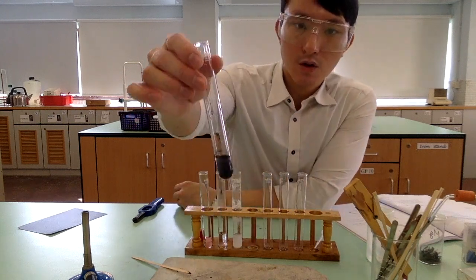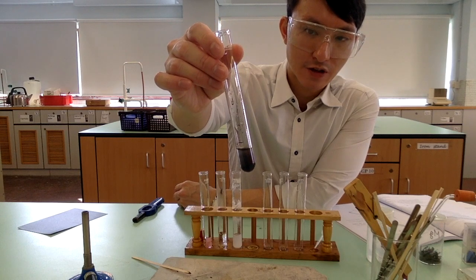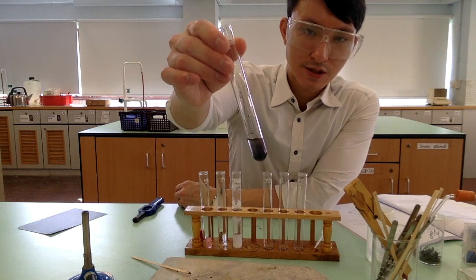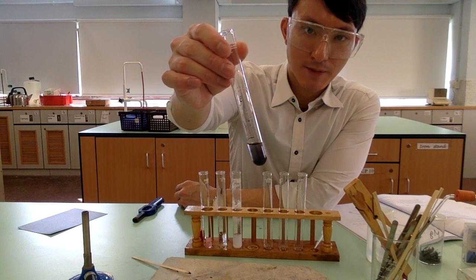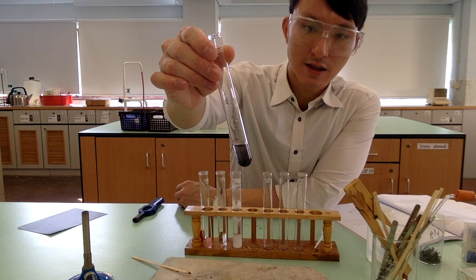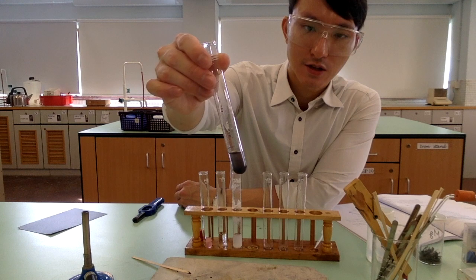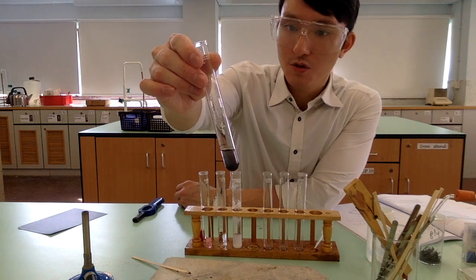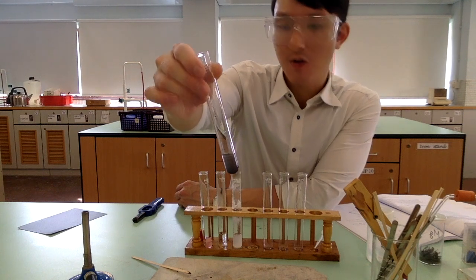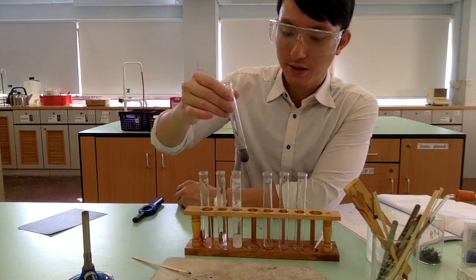Now, if you watch closely, do you think there is a chemical reaction involved? Is there any chemical reaction that has taken place? Actually, there isn't. Maybe you will be thinking that the solution has turned black, but actually this is only the copper 2 oxide suspending in the acid. And in fact, most of the copper 2 oxide has sunk to the bottom of the test tube. So there is no reaction and no observable change. But now, let's try to heat it to see if any reaction would take place.